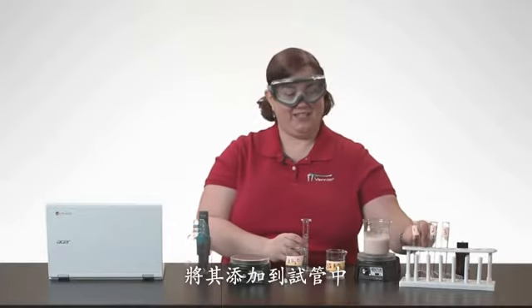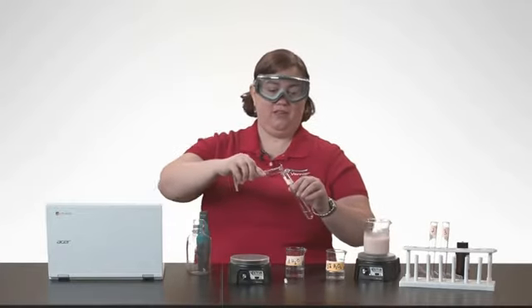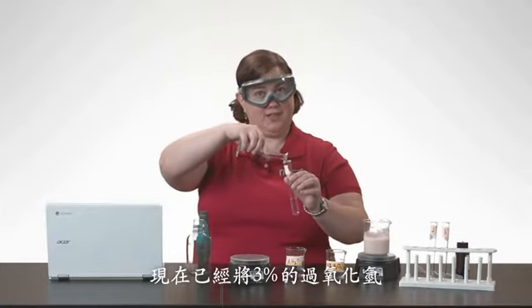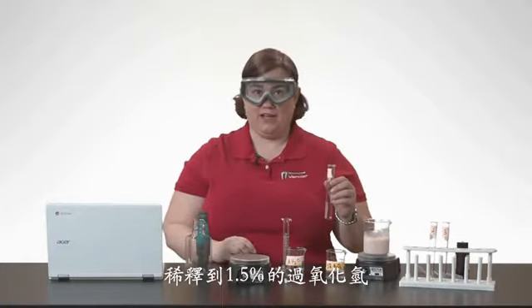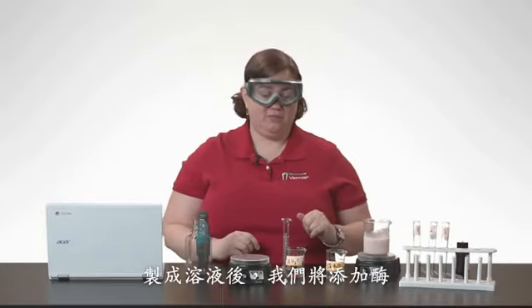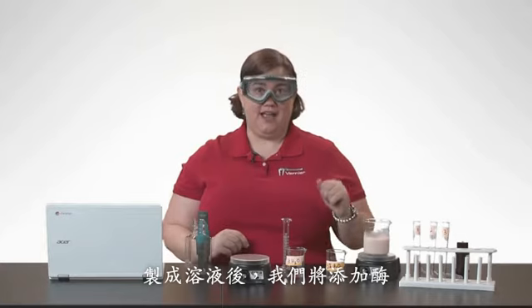And then add that to the test tube. This has essentially now diluted our 3% hydrogen peroxide now to 1.5% hydrogen peroxide. Once we have that solution made, we are then going to add our enzyme.